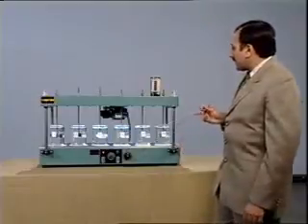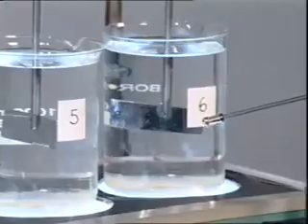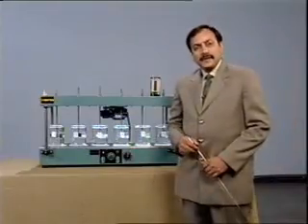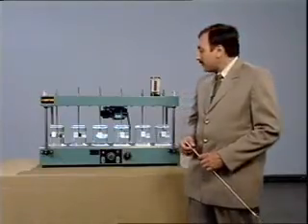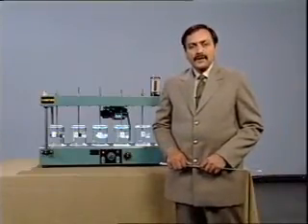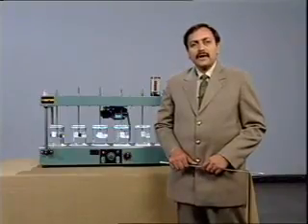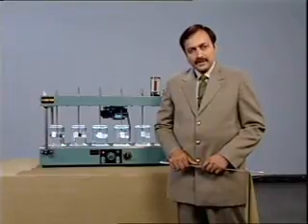In case the beaker with maximum dose gives the maximum clarity, we would need to repeat the experiment with a higher dose value with some suitable increments. Now, once you know the optimum dose of coagulant, it is possible to calculate the quantity of coagulant required for the purpose of water treatment.